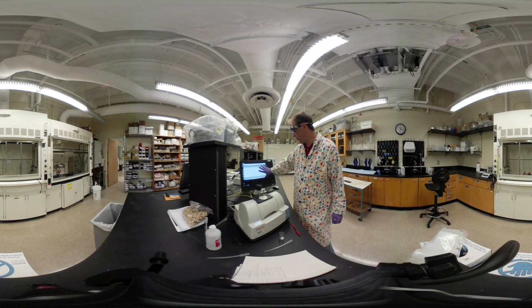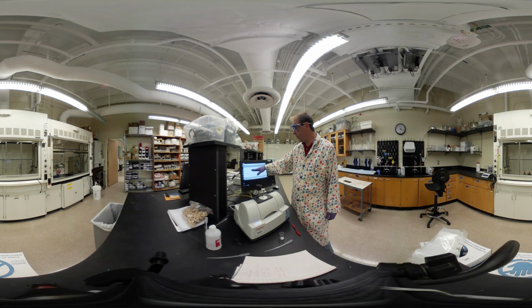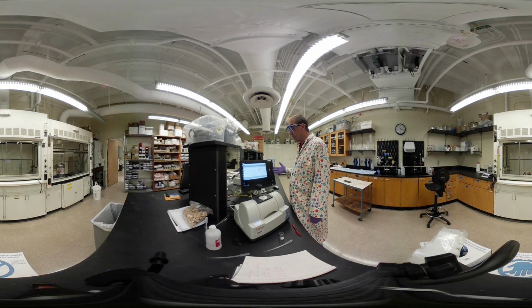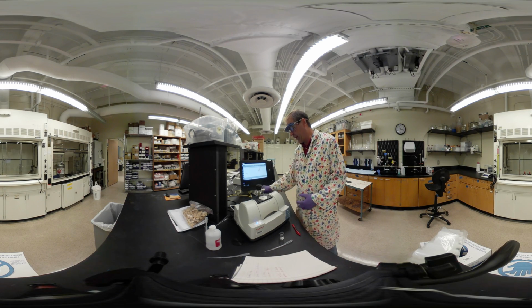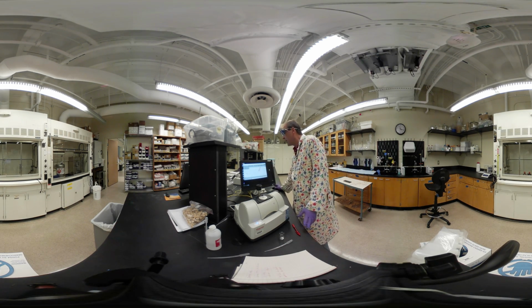All right, so we get the first general one. It's not very pretty. But what's going to happen is the instrument is going to look at whatever absorptions are happening right now, and it's going to subtract those from our sample. So it's going to take that out, and we don't have to worry about the air or anything else, the carbon dioxide or the moisture from the air. I'm seeing a moisture peak here because we are in Georgia. All right, so we're not going to add that.